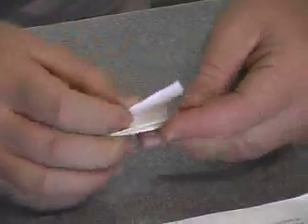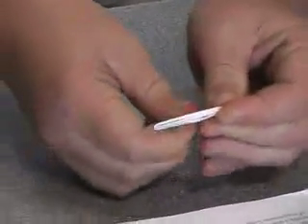Fold the filter paper in half, then fold it in half again, and fold it in half one more time. Then open it back out and place it in the filter funnel. Wet it so that it sticks to the sides.